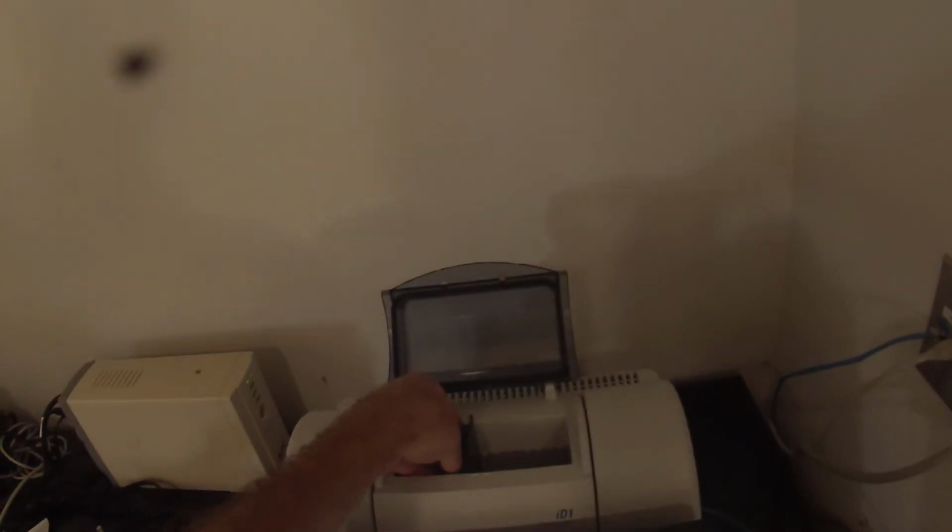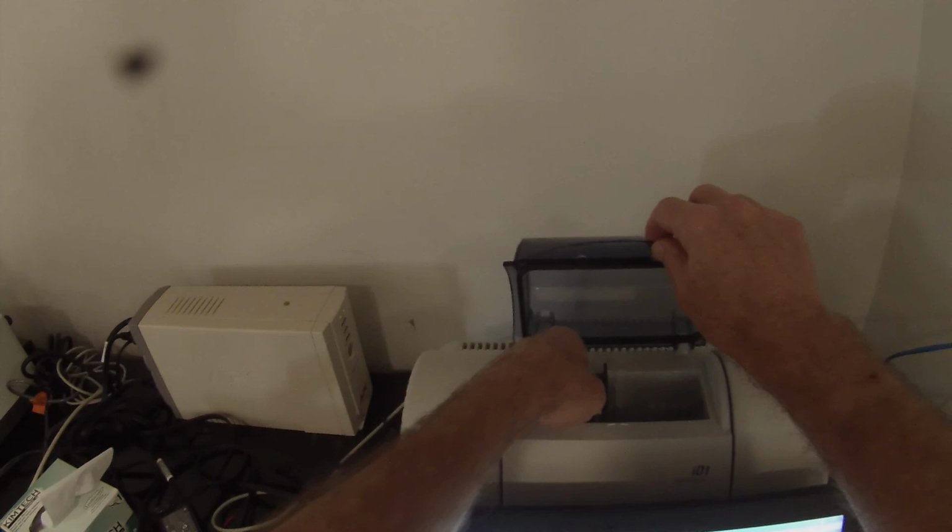Put the sample in there. This pellet's a little uneven too, but hopefully we're looking through a fairly transparent part. And that looks pretty good. Nothing's really bottomed out. Big OH stretch here, which you would expect. So we can save that.